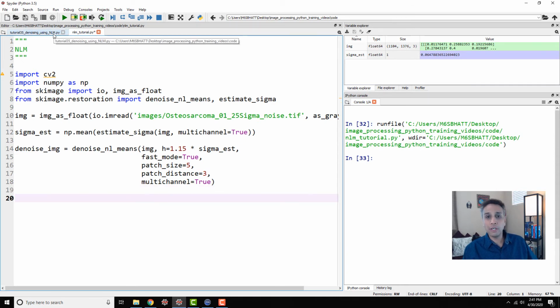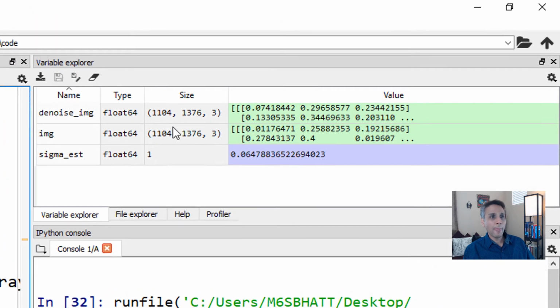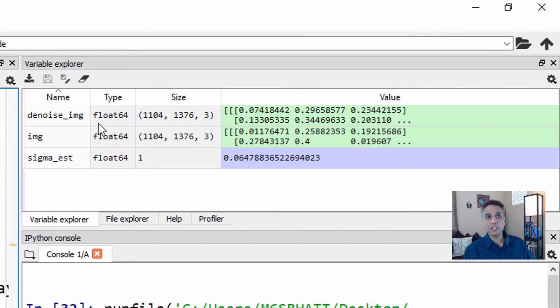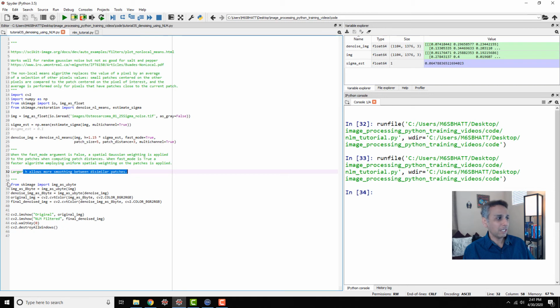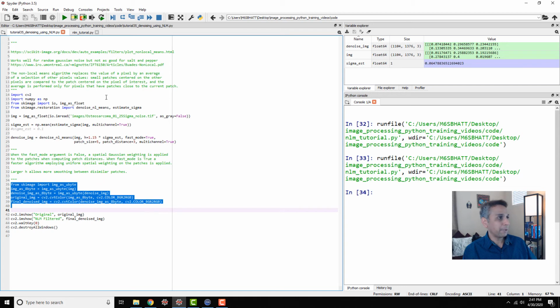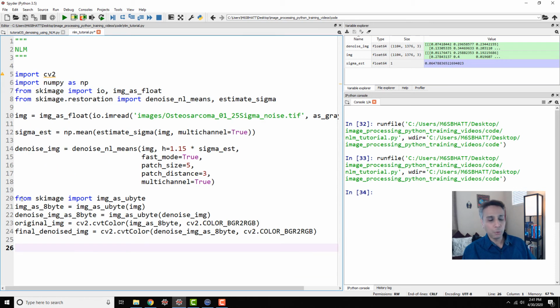Now let's go ahead and visualize the results. First, let's run the code until this point so you can see our denoised image is over there. Our denoised image is also a floating point image with values between 0 and 1. If you want to save these images, you have to convert them into 8-bit, and you know how to convert. Even for visualization, I'm converting them because I'm using OpenCV for visualization. If you use PyPlot, it doesn't make much of a difference.